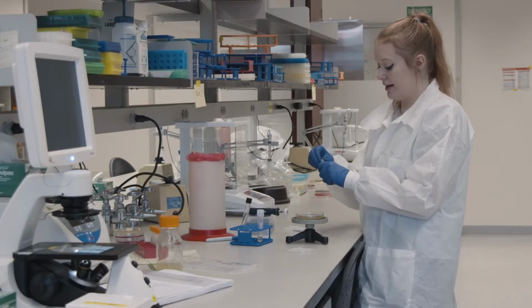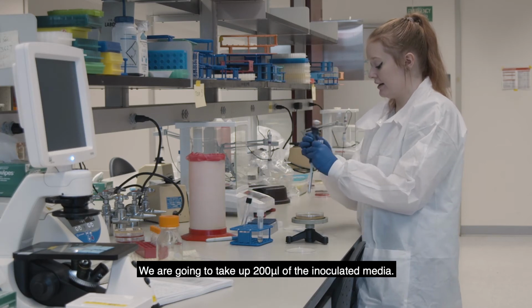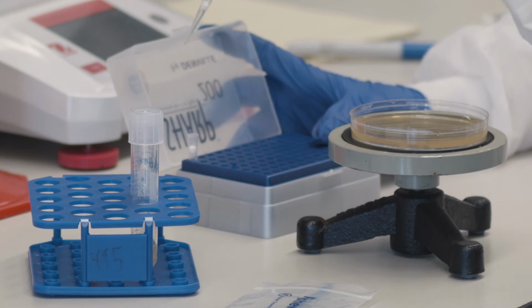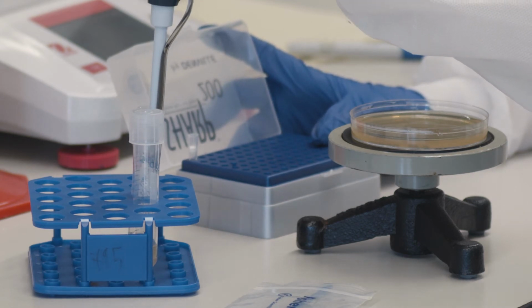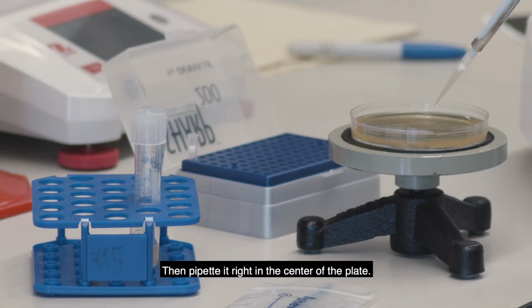So we're going to take up 200 microliters of the inoculated media, and then just pipette it right in the center of the plate.